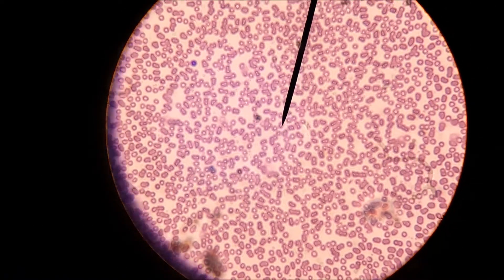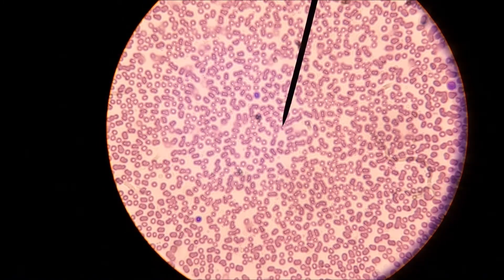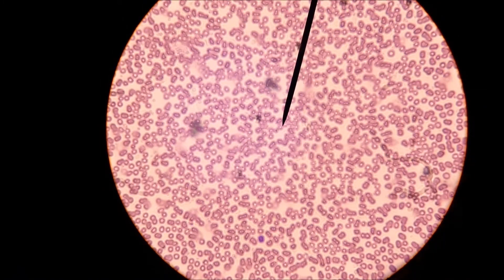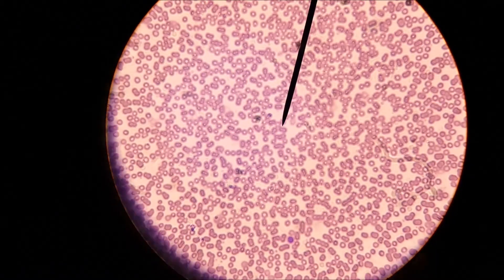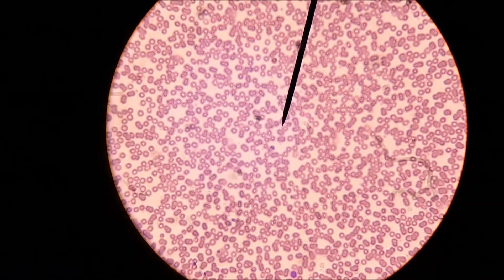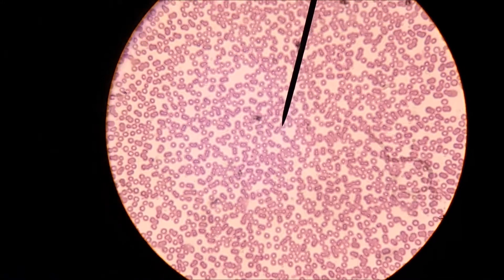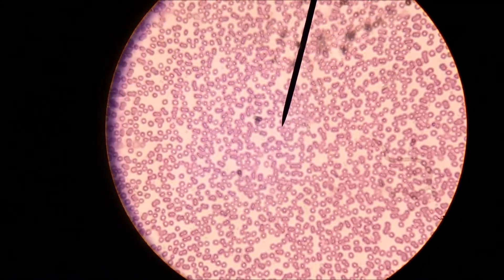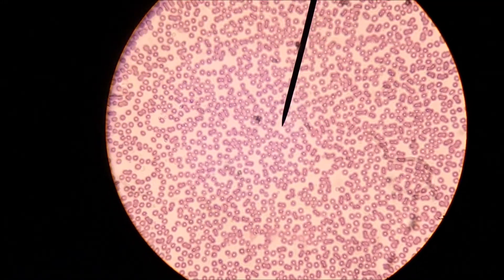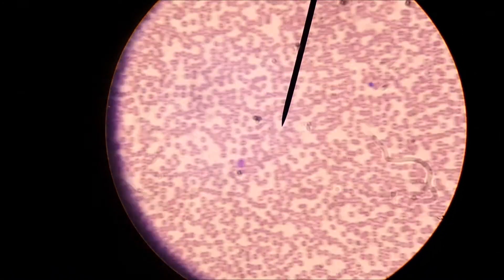I'm trying to find some cellular debris — it's just so hard for me to see with this view. Some little bits of cellular debris, little dots in between some of these red blood cells — those would be platelets. So you can see red blood cells, white blood cells, and platelets.